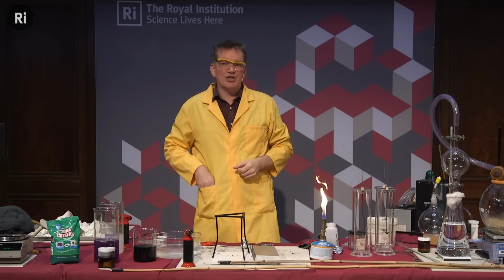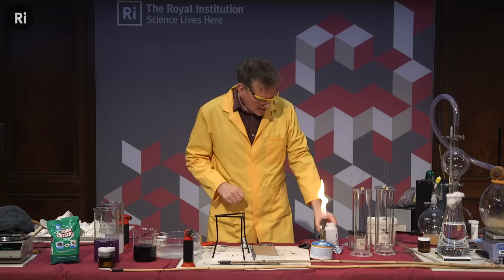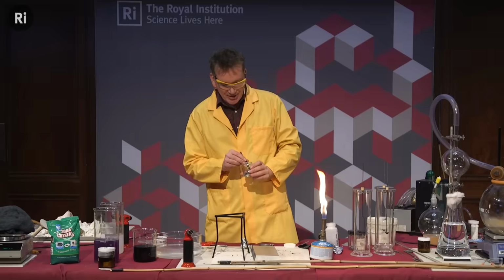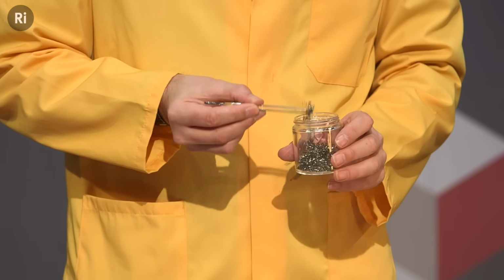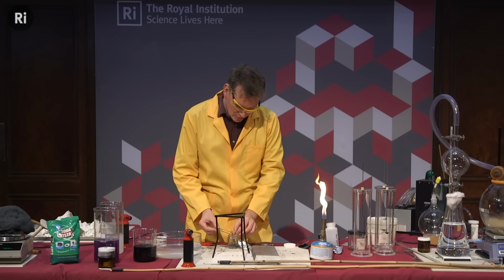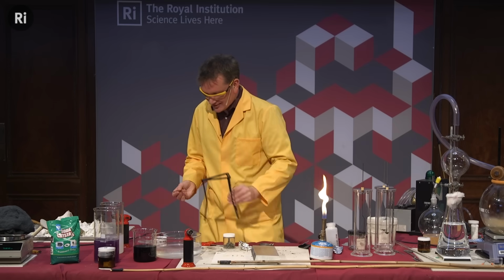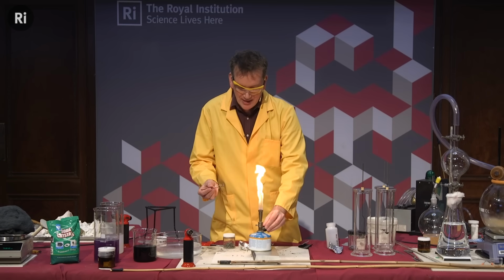Okay, let's have a look at some scandium. So I have a little bit of scandium here. It's very expensive because it is very rare. This is why Mendeleev didn't know about it, because it hadn't been discovered, because it is quite rare. So it's quite expensive, but I thought I should get some to show you, because I'm sure you want to see how it burns. Who wouldn't? I had never seen scandium burning before, so let's give this a go. So I have some very finely divided scandium here.